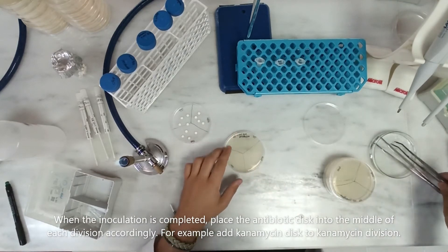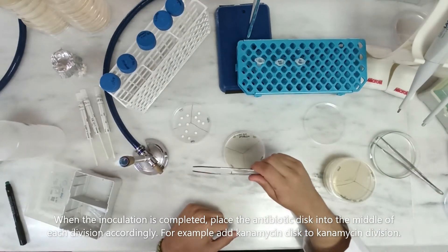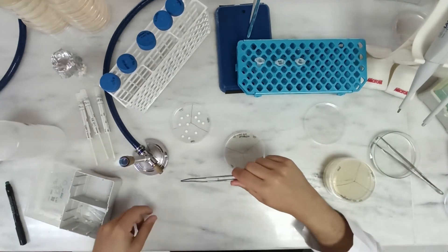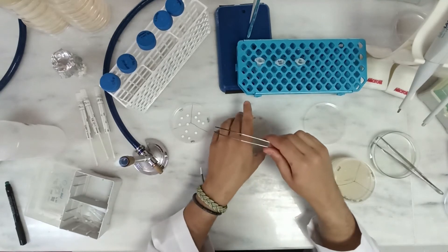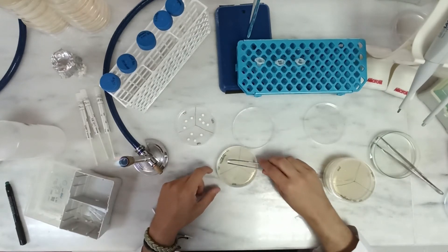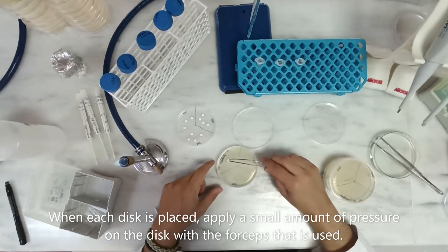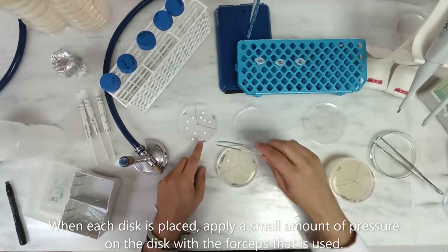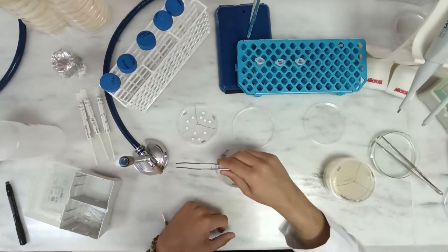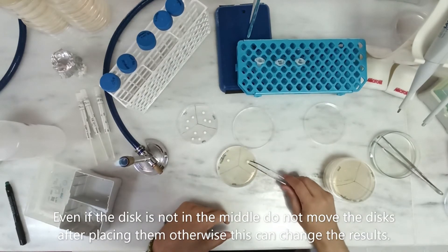When the inoculation is completed, place the antibiotic disk into the middle of each division accordingly. For example, add the kanamycin disk to the kanamycin division. When each disk is placed, apply a small amount of pressure on the disk with the forceps. Even if the disk is not perfectly in the middle, do not move the disks after placing them, otherwise this can change the results.